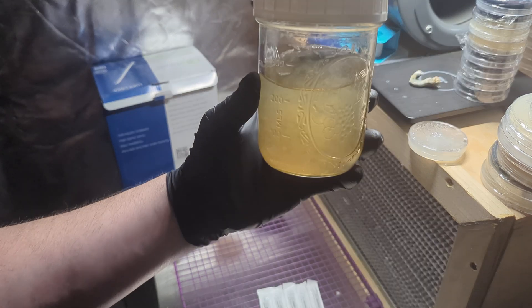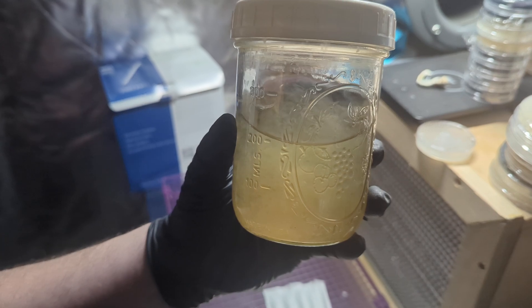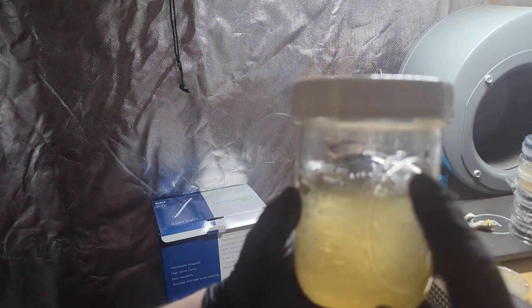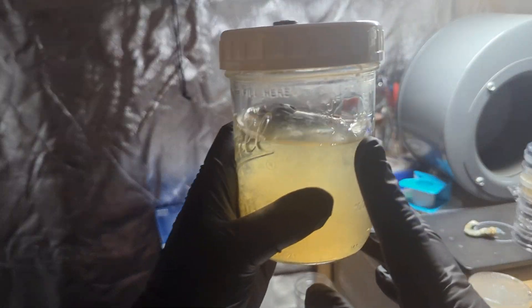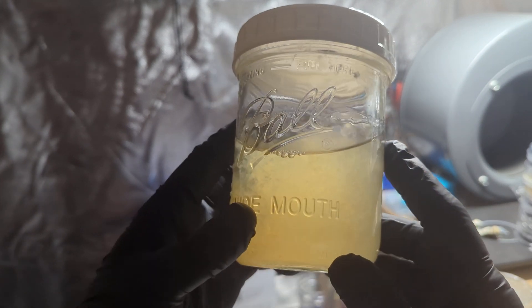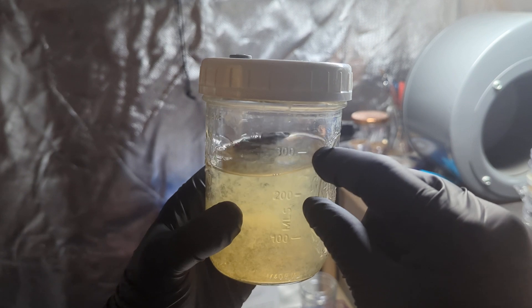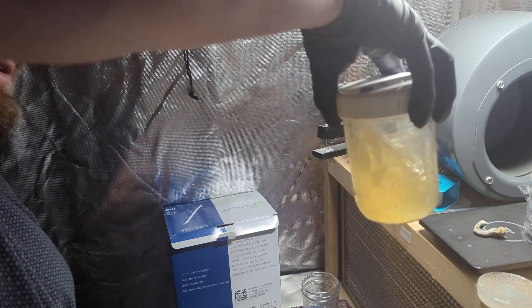This LC is done. It's clear at the top and very cloudy below. Having that separation and the clarity on the top is what I'm looking for, but it is a dense cloud.